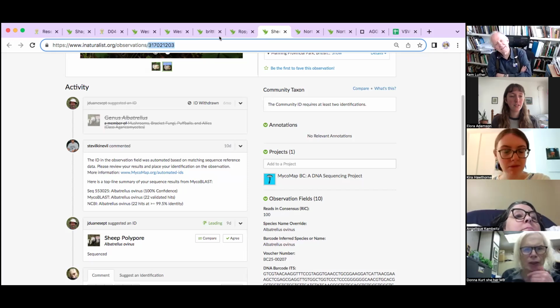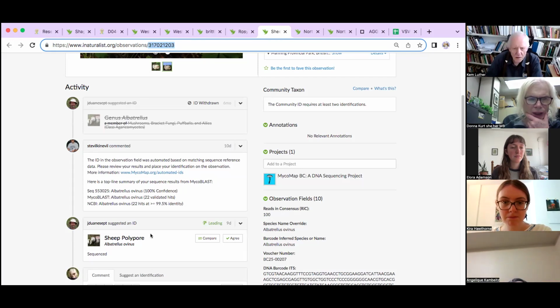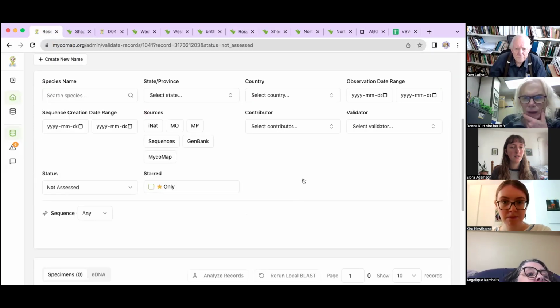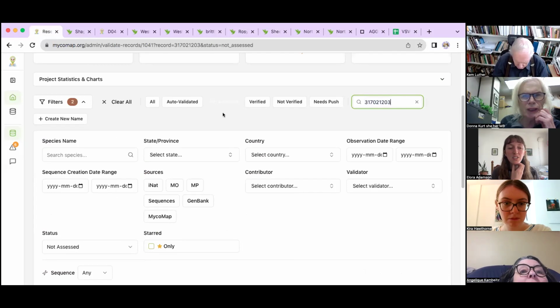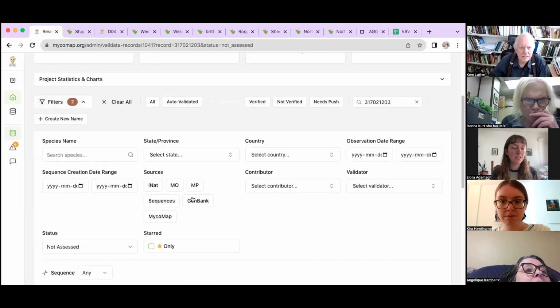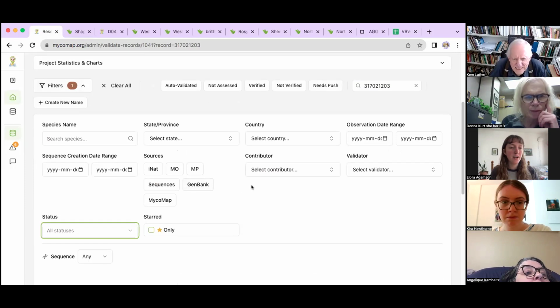So this one here is the one I was curious about, because it shows it was auto-validated. It's got Steve Knievel, and then J. Dwayne Sept indicated that it is sequenced. But I had gone in here and searched, and it doesn't seem to be coming up at all now. So if I put that iNat number in here and search, that's probably because it's not assessed. You have a filter on not assessed, so that could be why. If you change your status in the status filters, that should bring it back up. Do you see where it says status? Oh yes, yeah. Put that to all statuses. That would be the first step to try to find it.